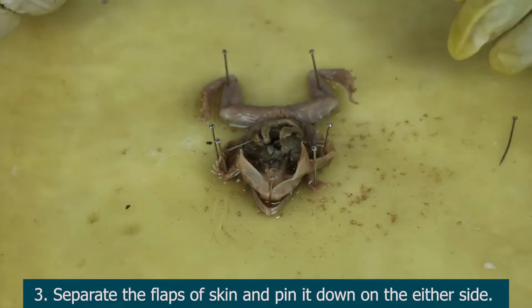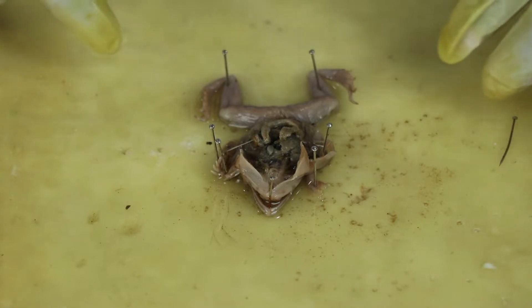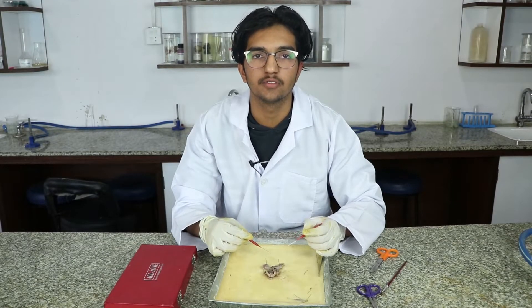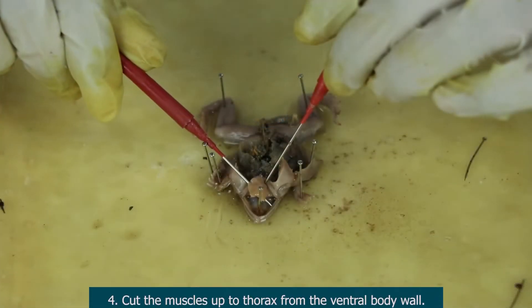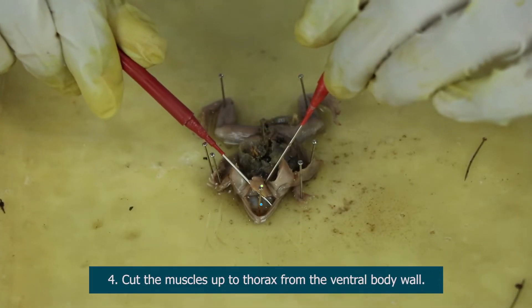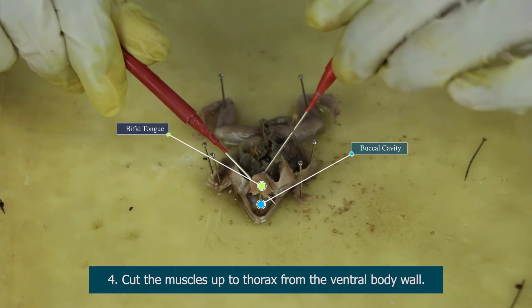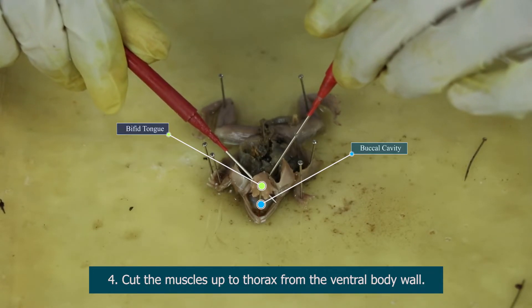Now you can see the intestines of the frog more clearly. We can expose the digestive system of the frog. After lowering the lower jaw, we can see the buccal cavity and the bifid tongue of the frog.